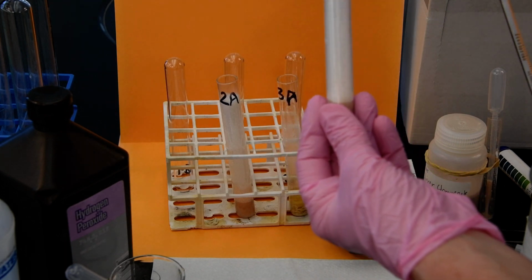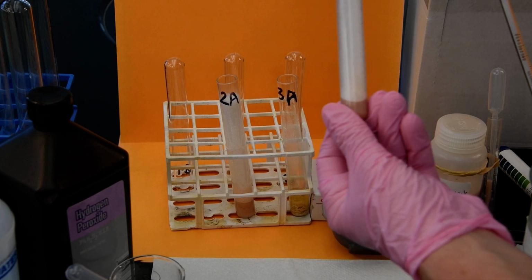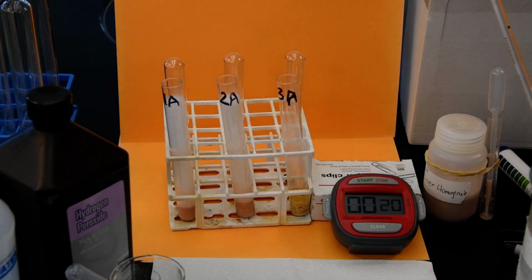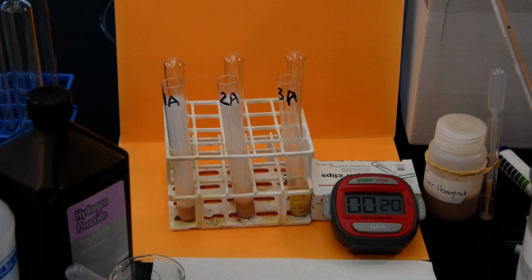But that really wasn't quite demonstrated, was it? We always have a little bit of difficulty with this one in the lab, and there are a couple of different reasons I would offer. I'm just doing it according to what we always have done as a protocol. But it could have to do with the fact that we have such a small container that the effect of this temperature on it is negligible.